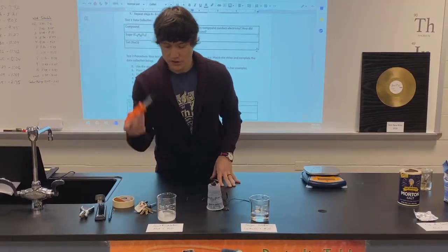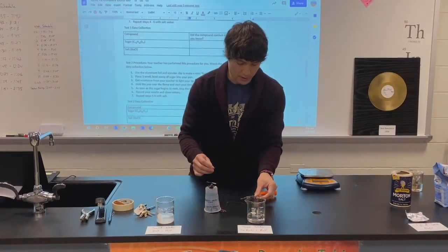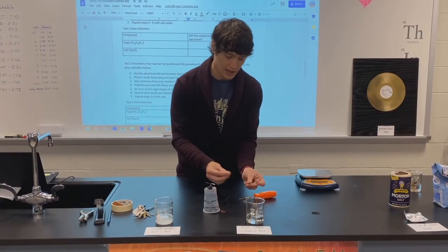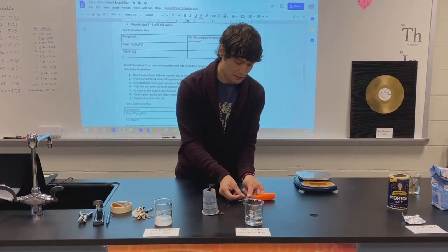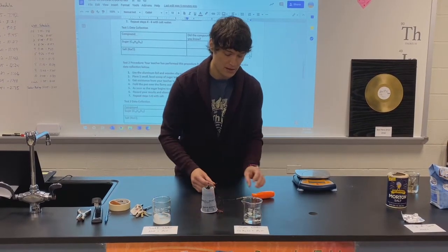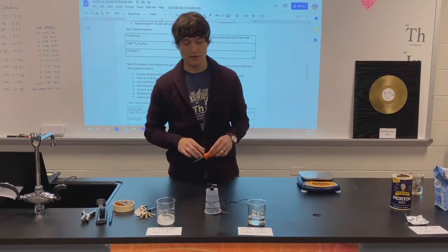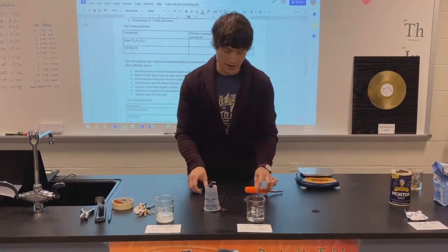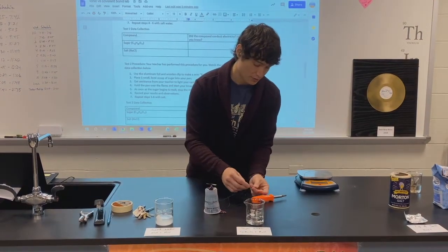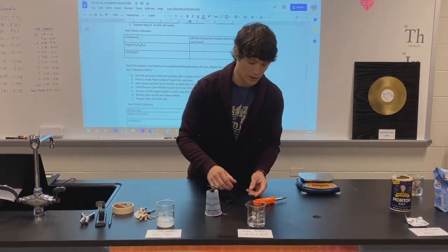We could just test some random objects — a screwdriver. We'll take a look at the metal part of the screwdriver. You'll notice I'm not going to touch these; I'll just put them on the screwdriver and it will make the propeller spin because the electricity is in fact running through the screwdriver. If I tried on the handle of the screwdriver, which is plastic, no conduction there.